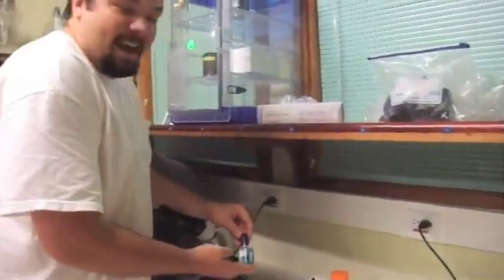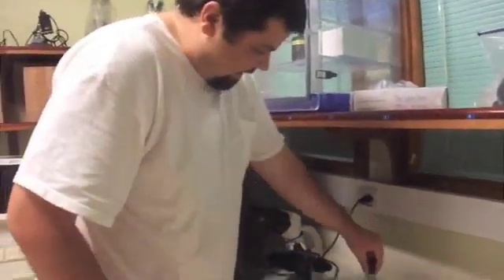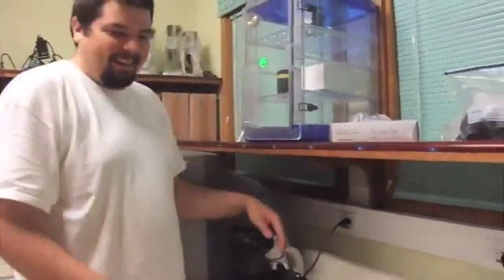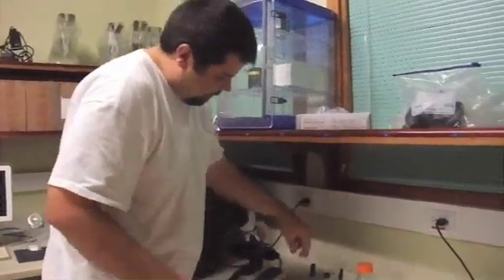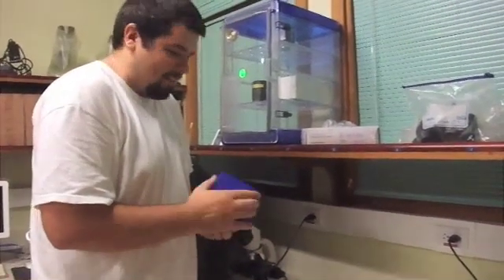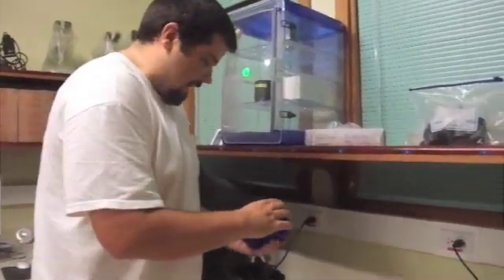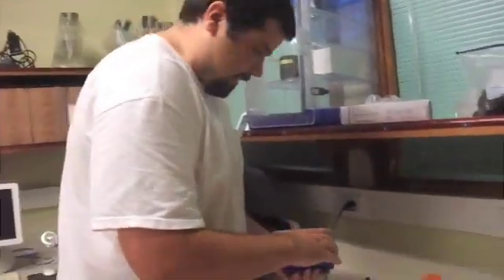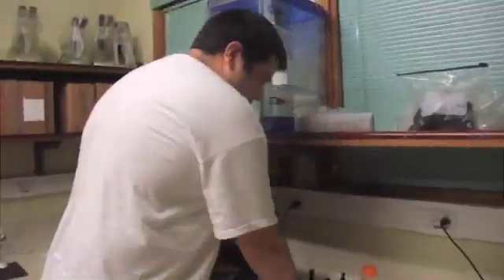Another one: nail polish. Nail polish, yeah, seriously? Exactly, seriously. Clear. If you're embarrassed, they'll never know. Okay, what else? And a cover slip, okay. A slide box, slide box, okay, for long-term storage. Okay, long-term. Polish, so good. That's what you need.